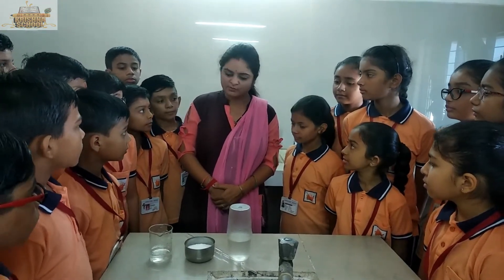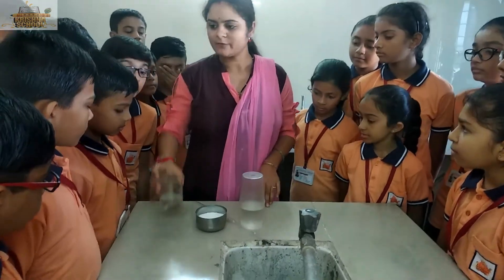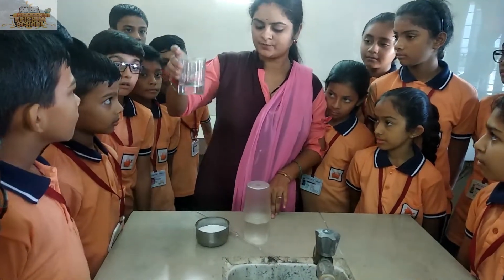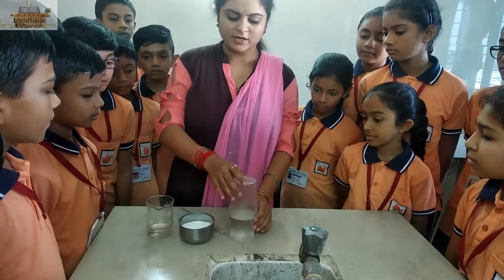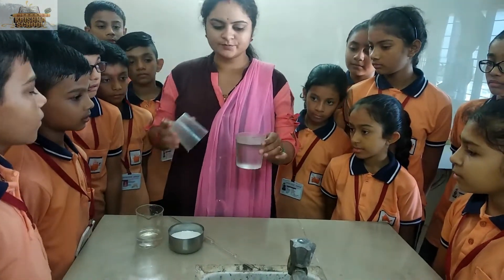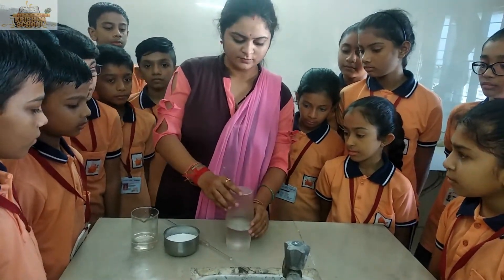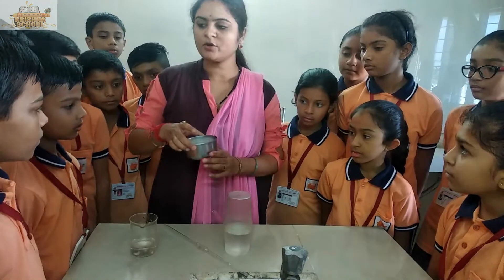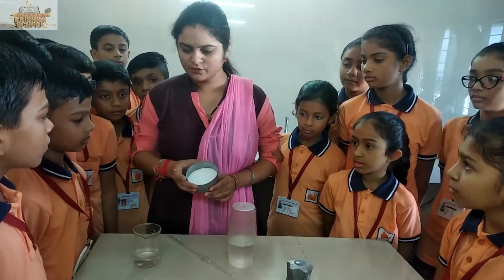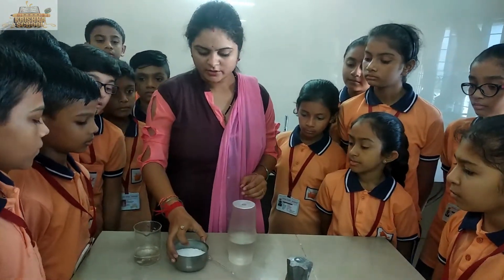For this practical we need some tap water, some hot water, and a great amount of salt.